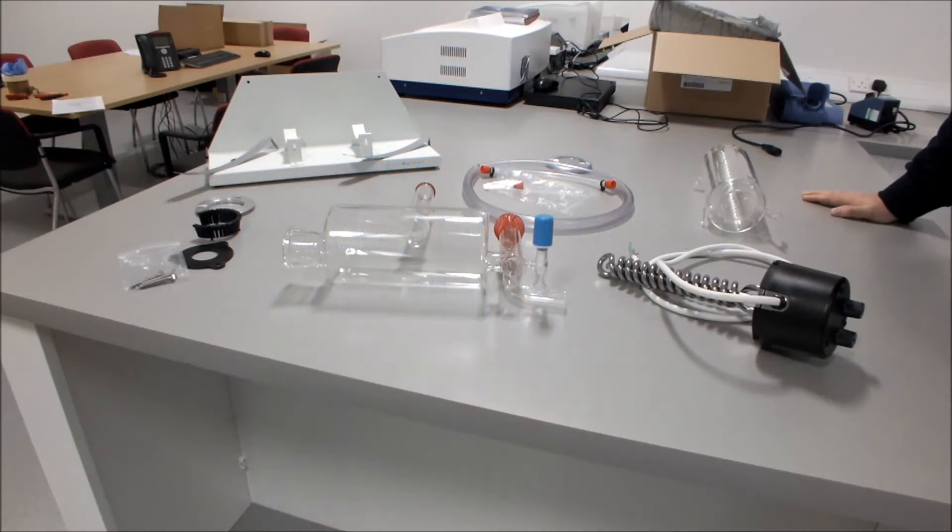This video is about the installation of the Stuart Merritt W4000 water still. When you receive your water still, you need to check the contents of the box.